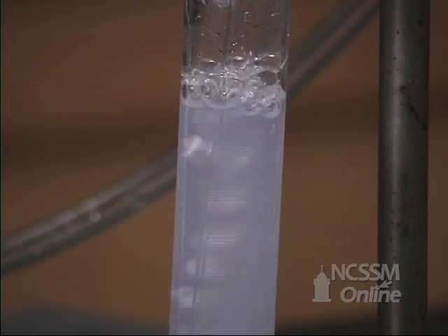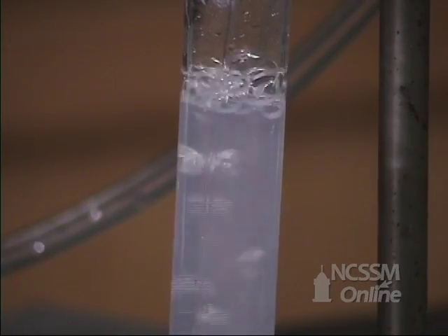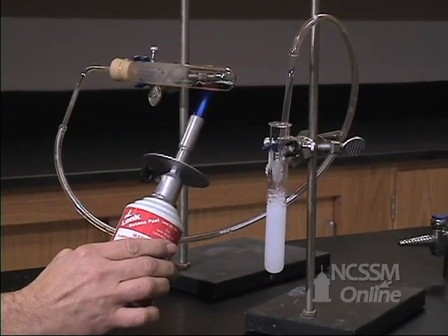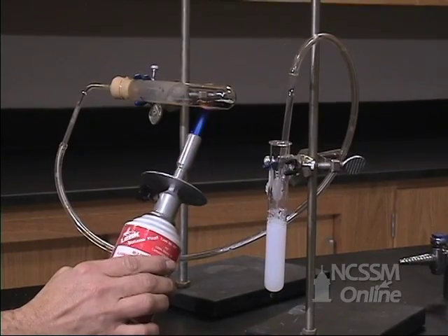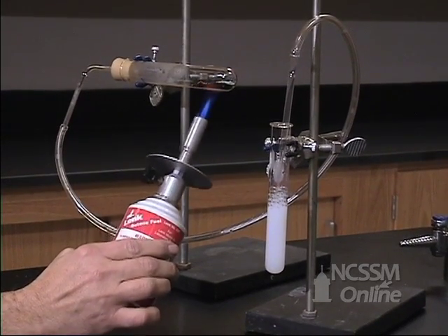the carbon dioxide reacts with the lime water, which is calcium hydroxide, to produce insoluble calcium carbonate. This appears as a white solid in the test tube.